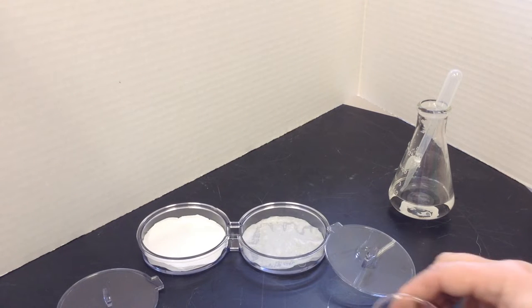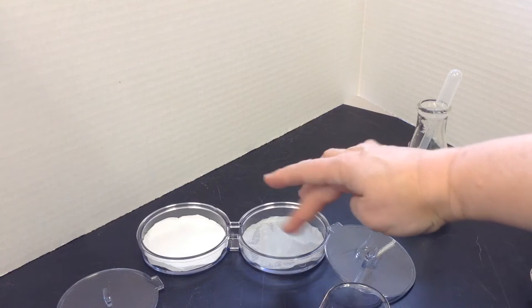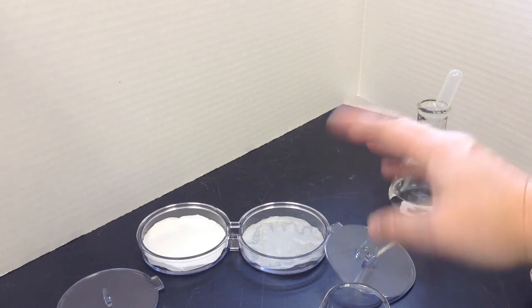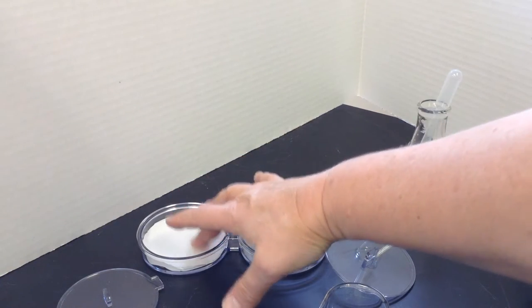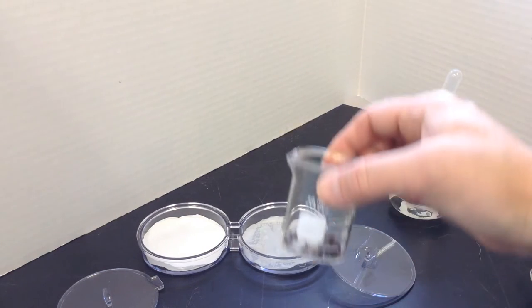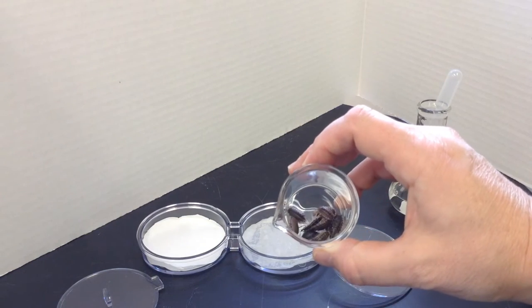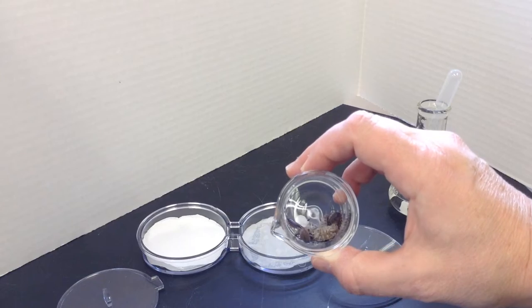So we've made one side of our choice chamber wet. I've just dribbled some water in here. You don't want too much because the other side needs to stay dry, and we have some of our little guests here ready to make their choices.